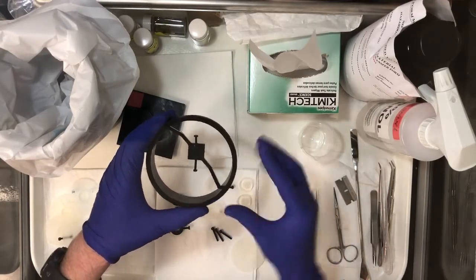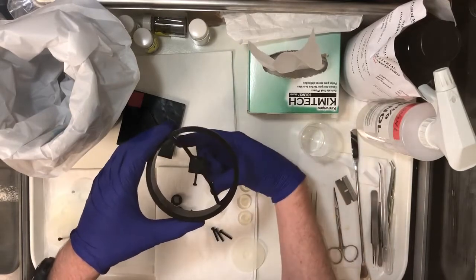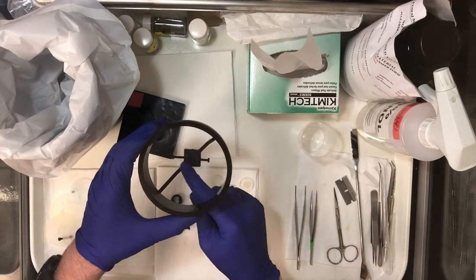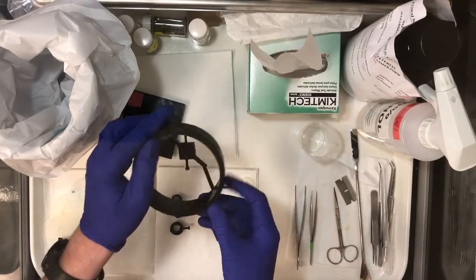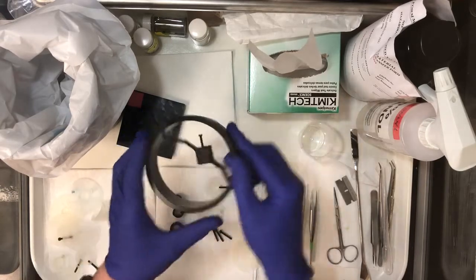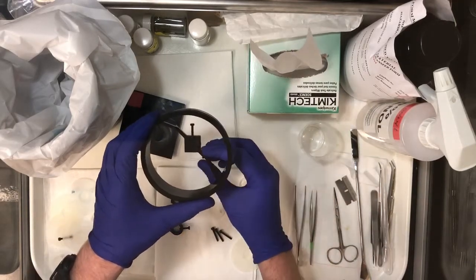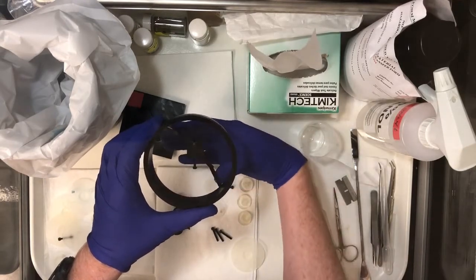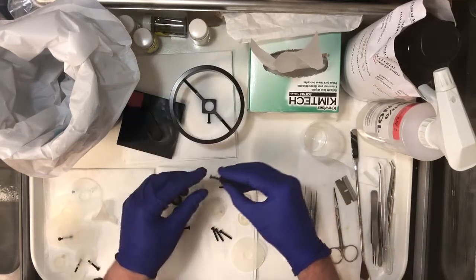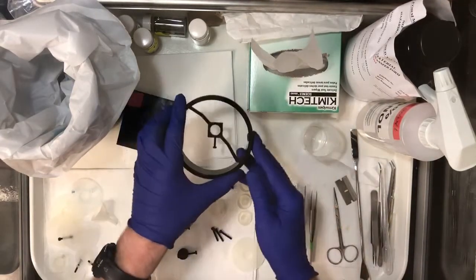When placing the holder in the cradle, it's a good idea to orient the screws anti-parallel. The light sheets come from the right or left, so we can't have the posts or screws blocking the middle — it always has to be oriented either one diagonal way or the other. The cradle doesn't fit in the light sheet if oriented straight, so it must go in diagonally. The workflow is: put the sample in a holder, put the holder into the cradle, then put the cradle into the light sheet.